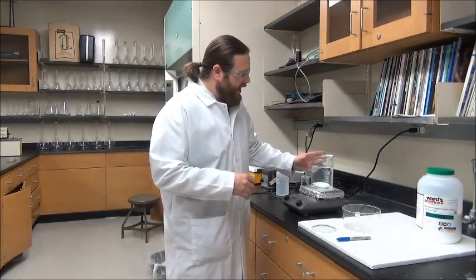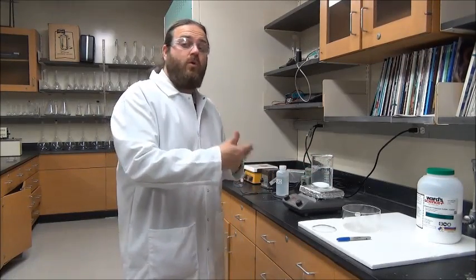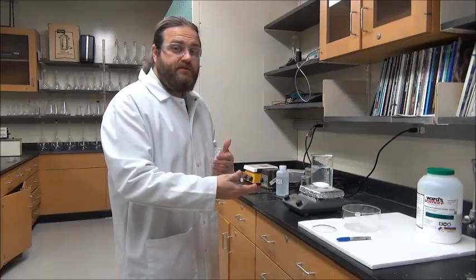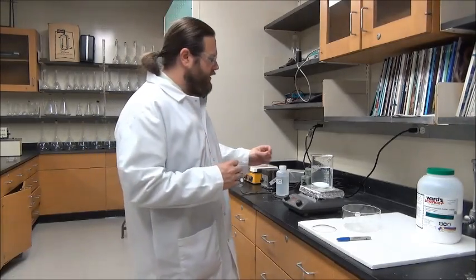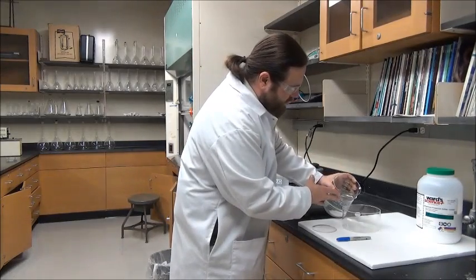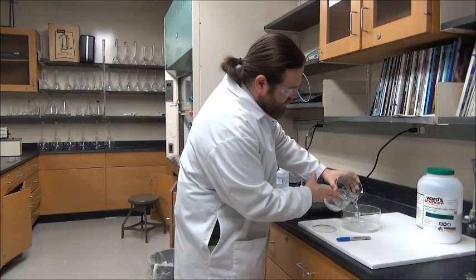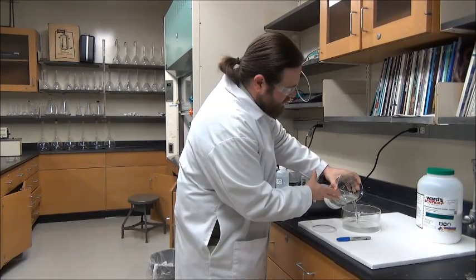Here we go, we have our solution, it's nice and clear. At this stage, if you wanted to, you could also filter it. What we're trying to get is a clear solution - the cleanest possible solution. That's why we use that deionized or distilled water in our initial setup. We'll go ahead and take this and pour it into our crystallization dish.